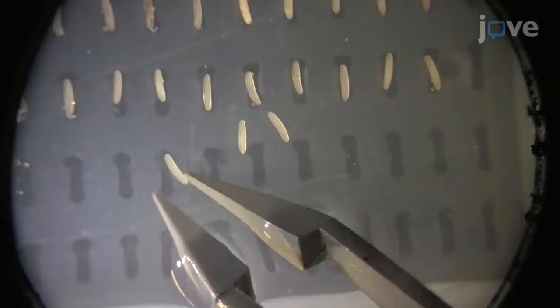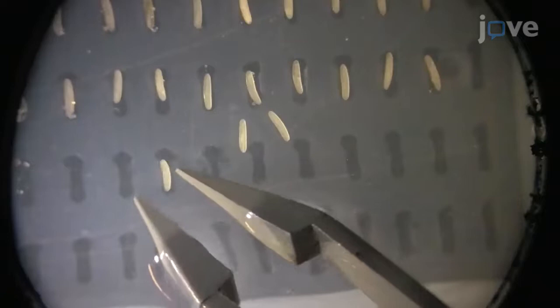This technique serves as a foundational method for experiments designed to assay the embryonic or larval development of the cricket. The main advantage of this technique is that it is flexible and will support several types of experimental approaches, such as those utilizing RNA interference or genomic manipulation. Demonstrating the procedure will be Hadley Wilson Horch, the principal investigator in the laboratory.